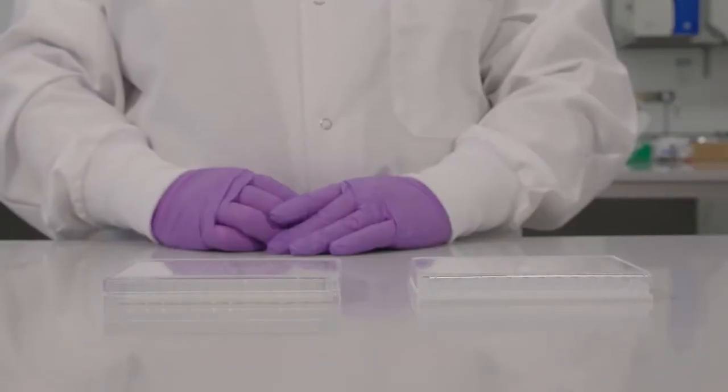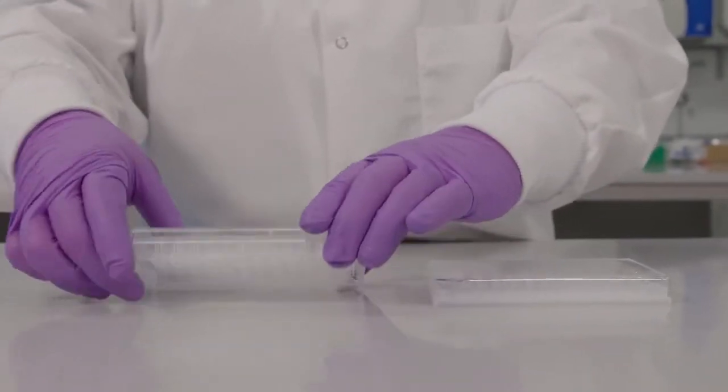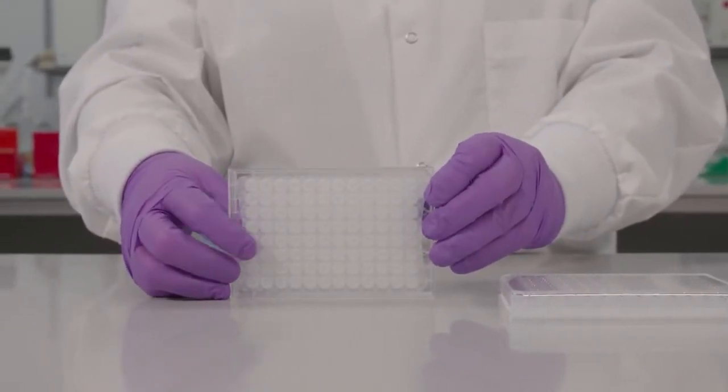The 96 well high throughput sampling or HTS design also allows the under drain panel to be separated away from the filter wells.